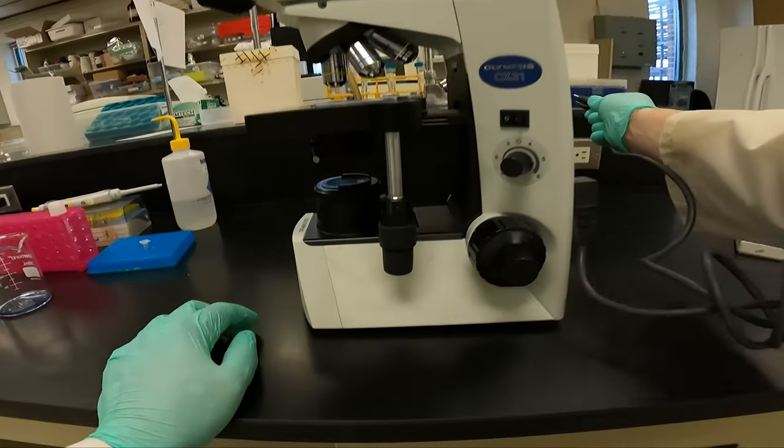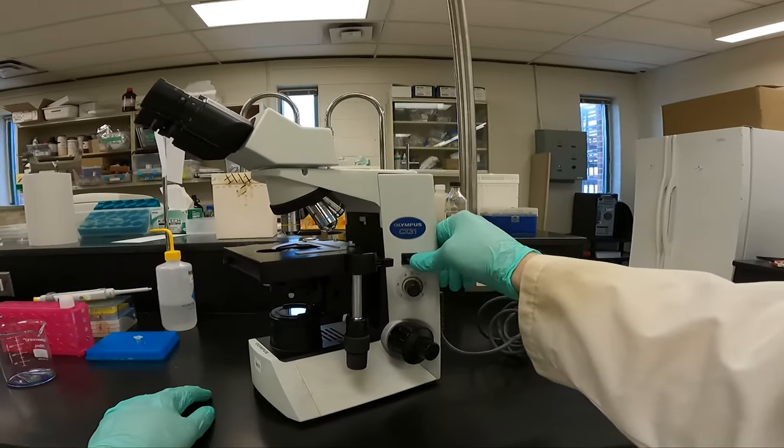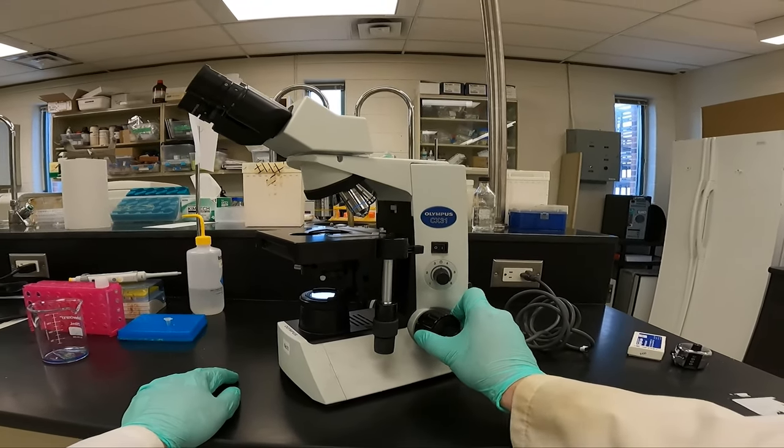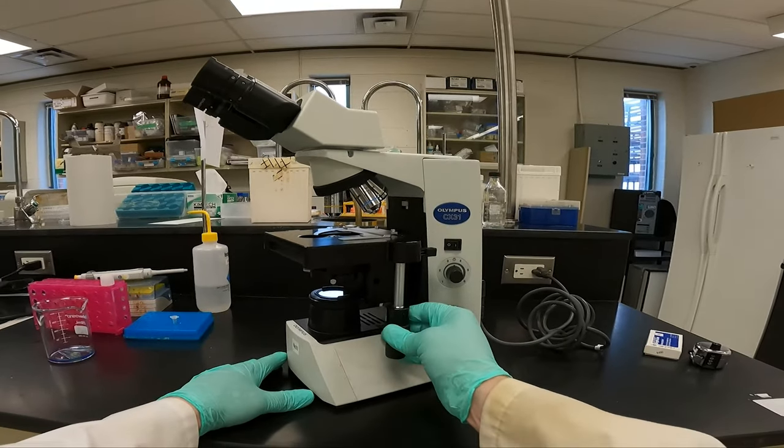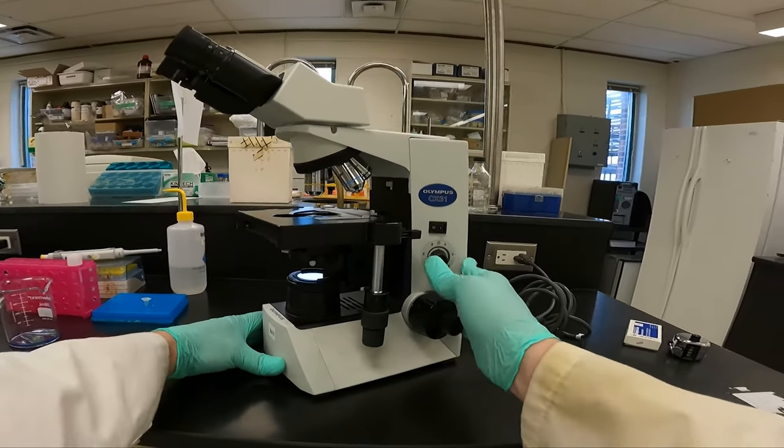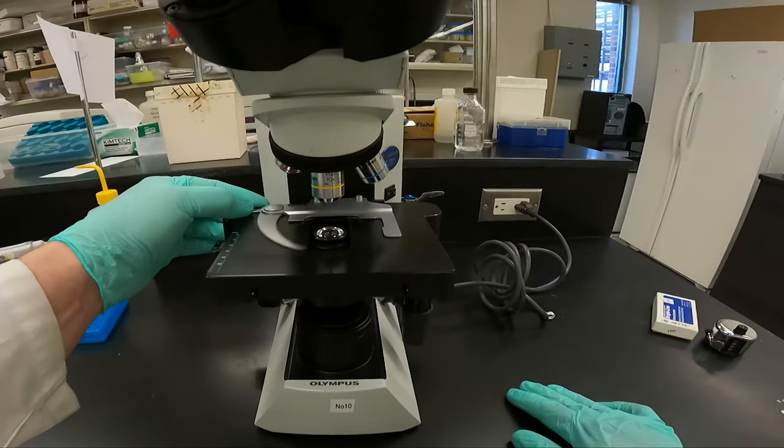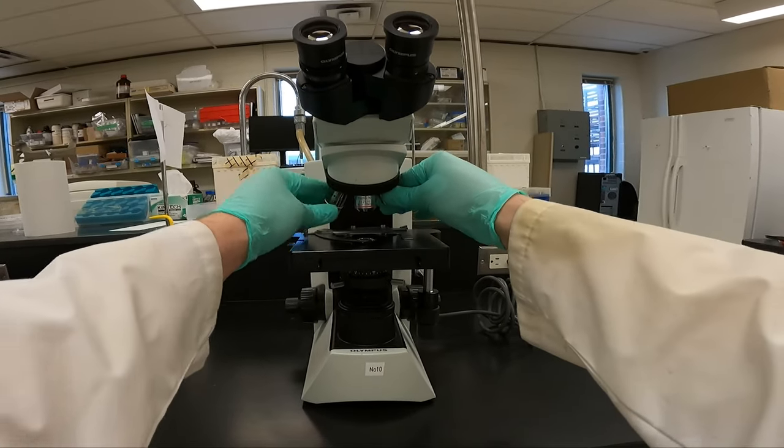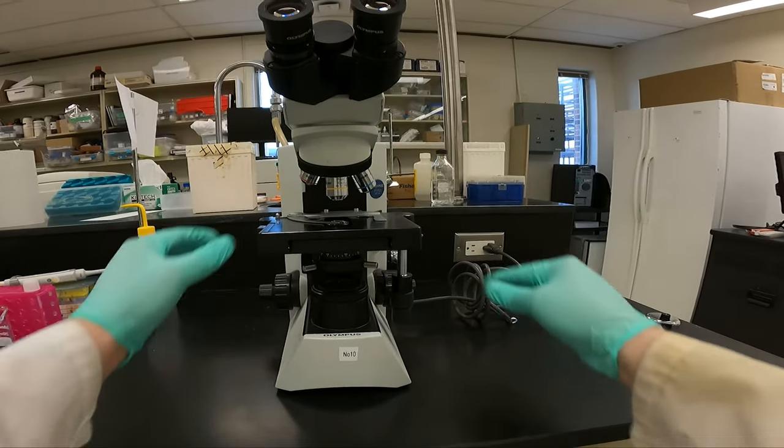You plug the microscope in. Let's go through some of the features now. We have the on-off button, light adjustment, focus adjustment, stage manipulator. We have our stage clamp, objective lenses, low power, medium power.